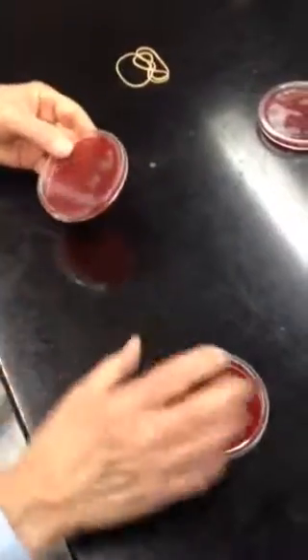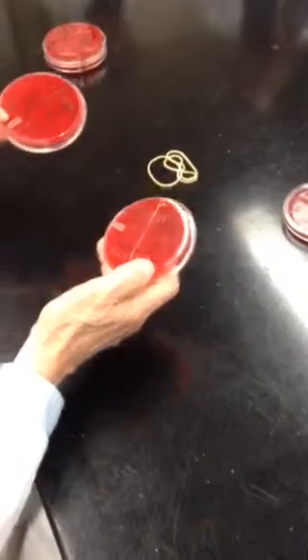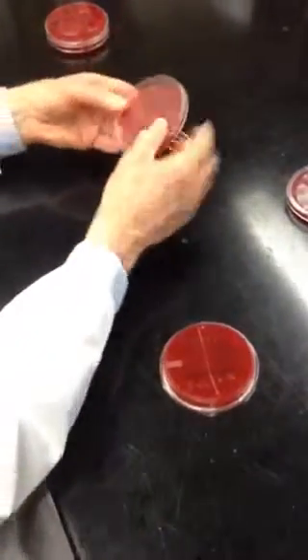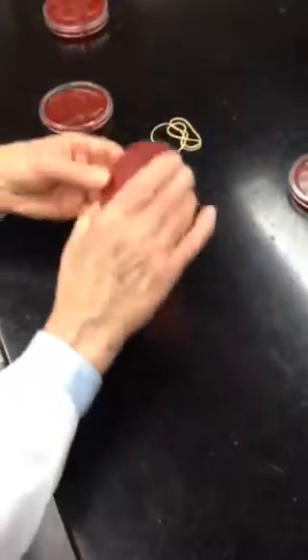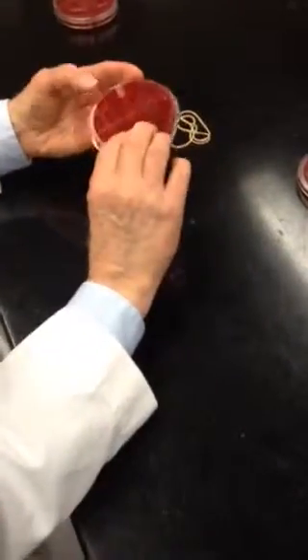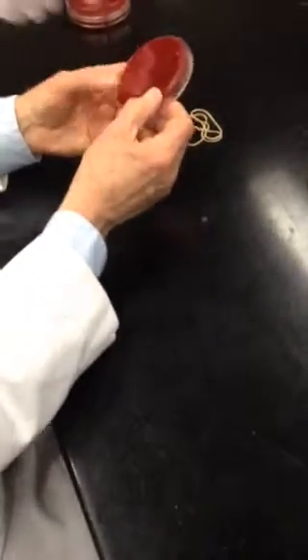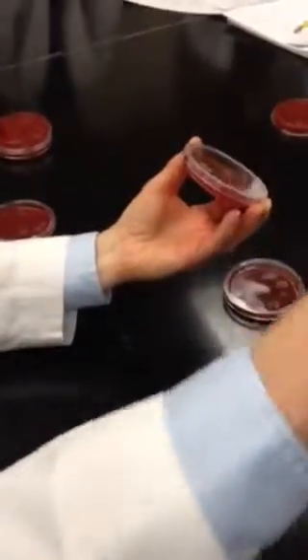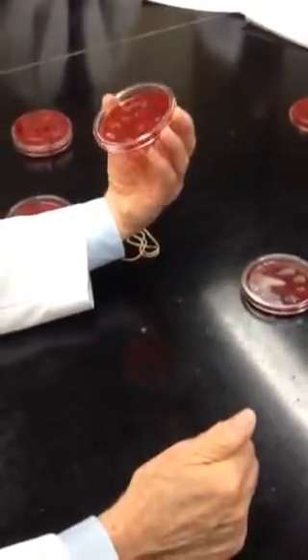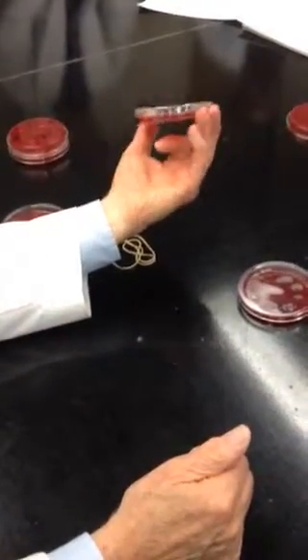Then these, I assume, are the soap. Right? Soap. Okay. So this is dry, 30 seconds with water, and this is using soap, 3 minutes. Washing for 3 minutes, 5 minutes with soap, using our hand soap that we have over there in the sink. 5 minutes has even more growth than 3 minutes. The more you wash, the dirtier you get.